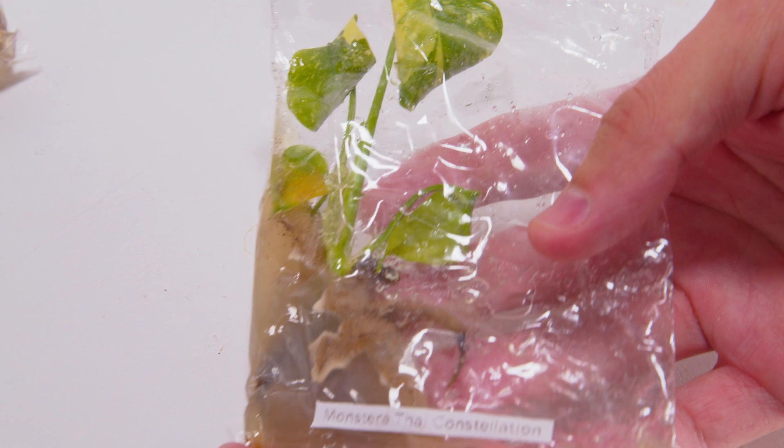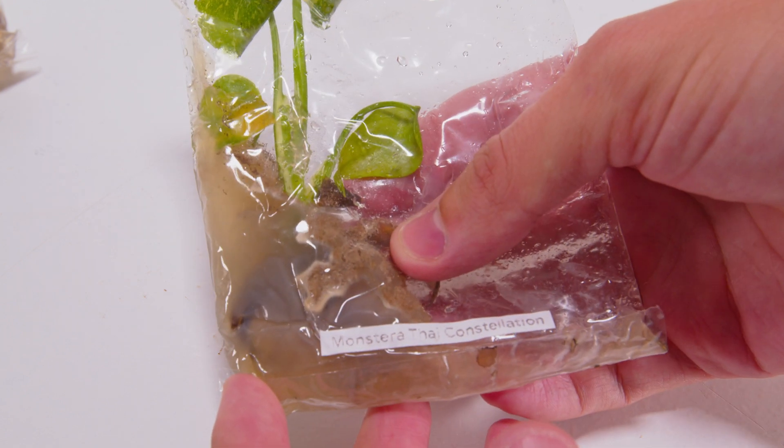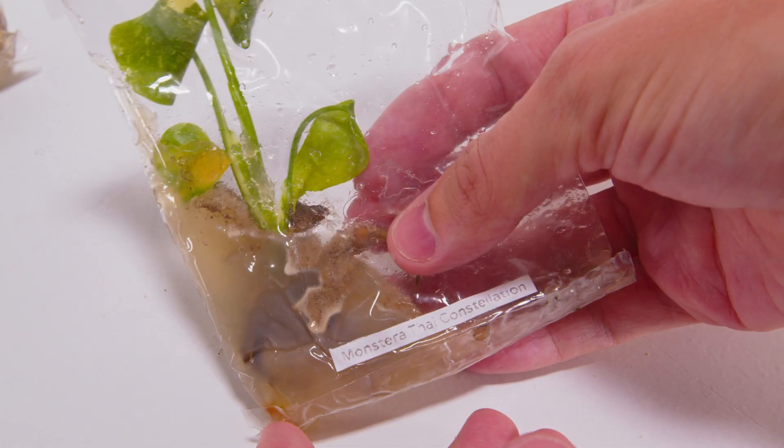They use a lot of different sanitizing things, but I did not do this at all — I just used plain water. I'm not a huge fan of using a bunch of fungicides, bactericides, and things like that. I just think you're setting yourself up for another sterile environment and waiting for some invader to move in and monopolize the place.